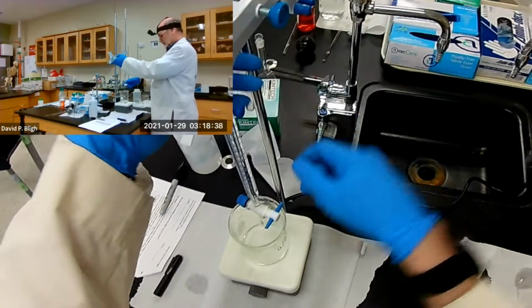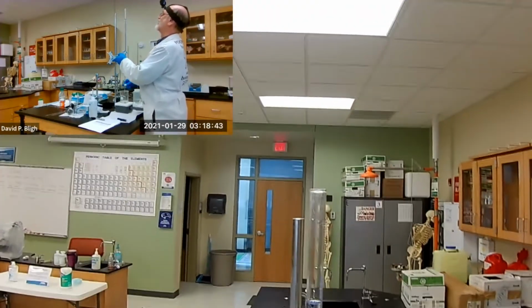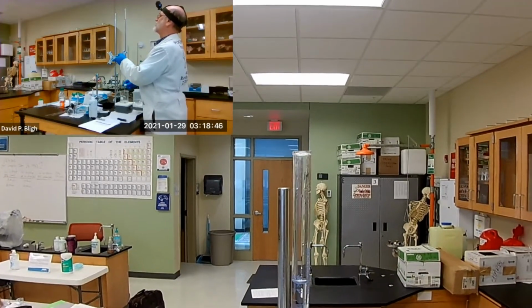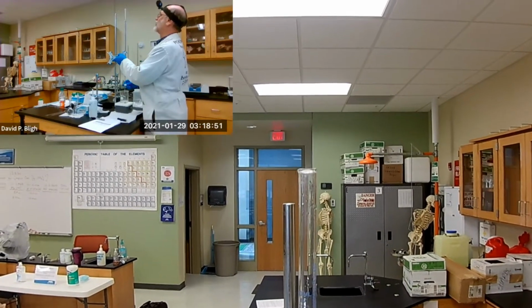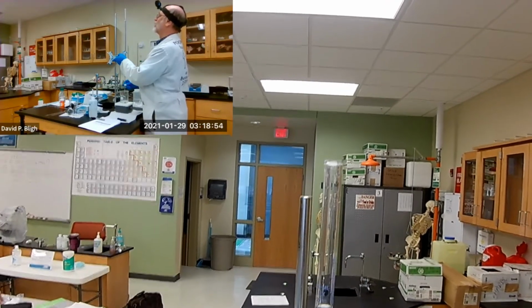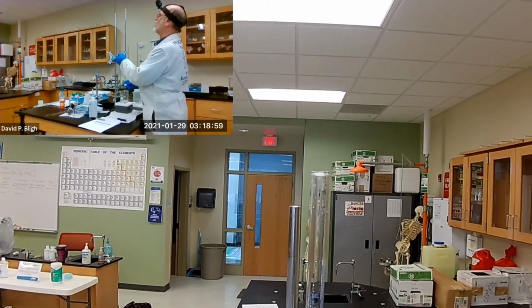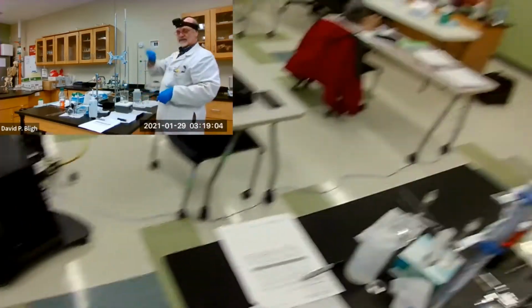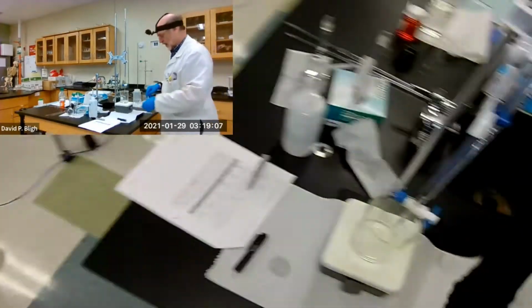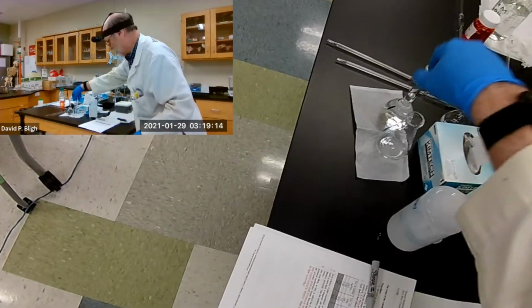Okay, so let me delicately bring it down. Got my eye level with the 0 mark, and we're coming down. And let's slow it down a little bit and let it drip slowly. So I want to be right on the mark. There it is. The bottom of my meniscus is right on the 0 mark now. There we go. Now we can do the titration.